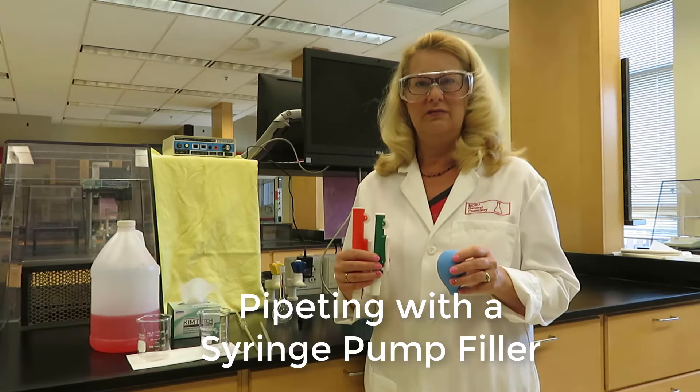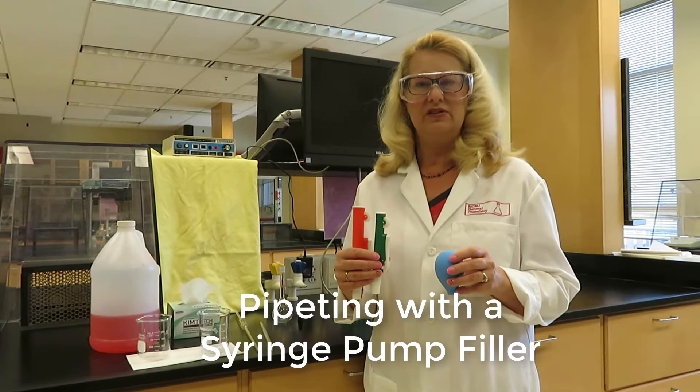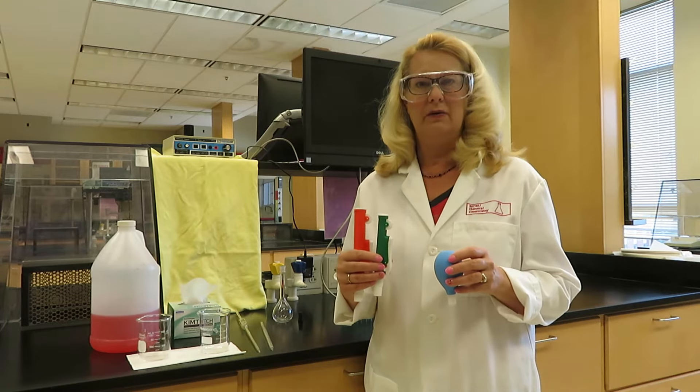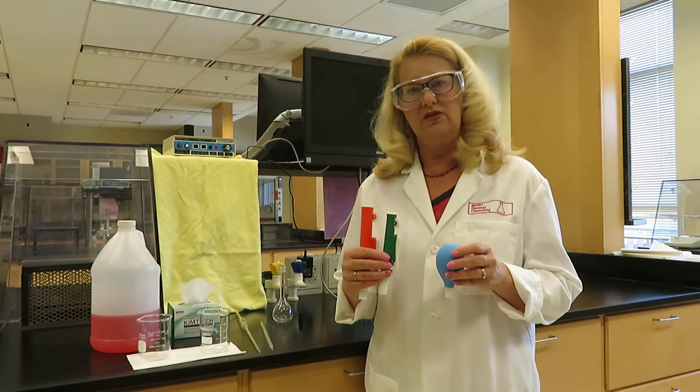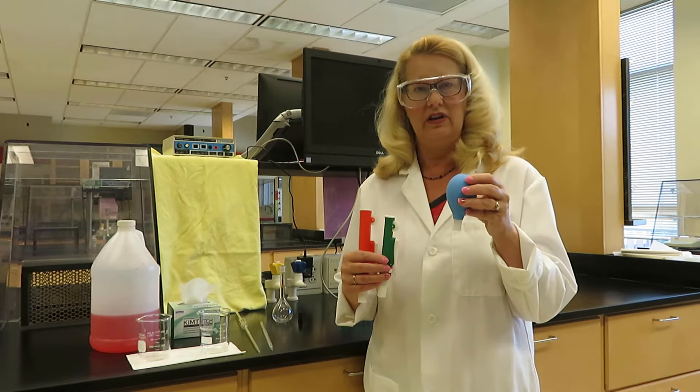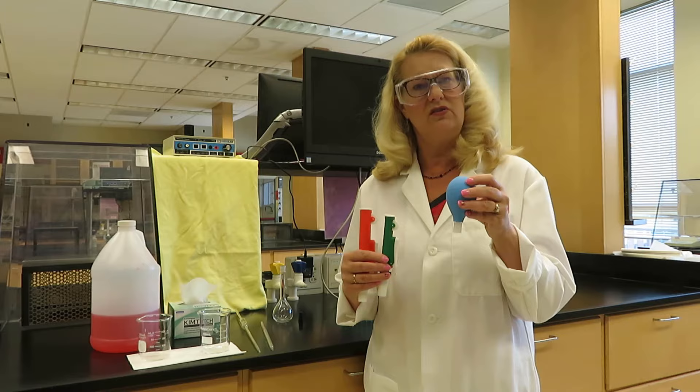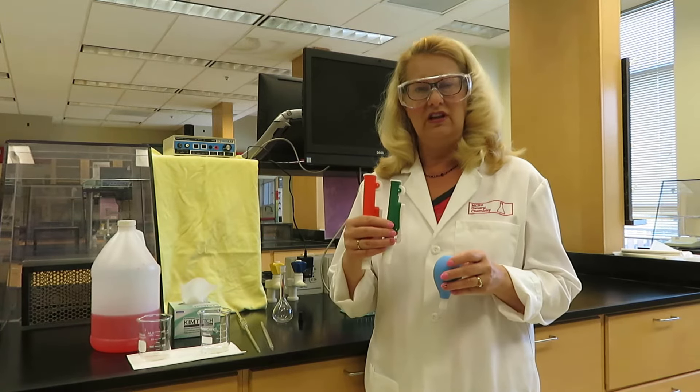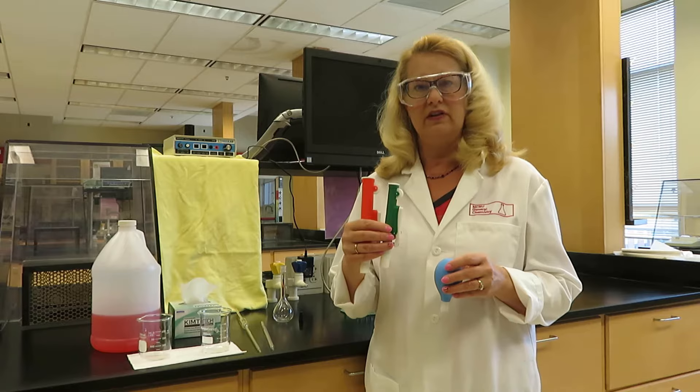Hello and welcome to NC State's General Chemistry Labs. This is our new pipetting video. It's a new video because we used to use the rubber bulb filler in our videos for pipetting, which students sometimes found a little bit challenging.